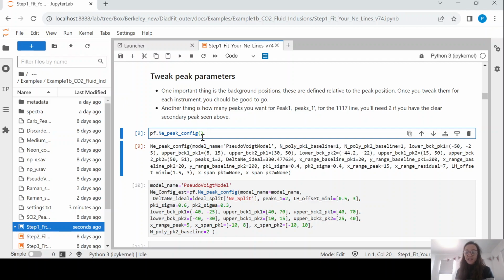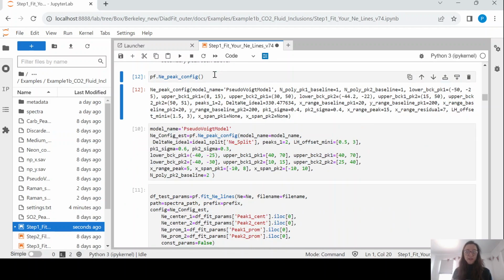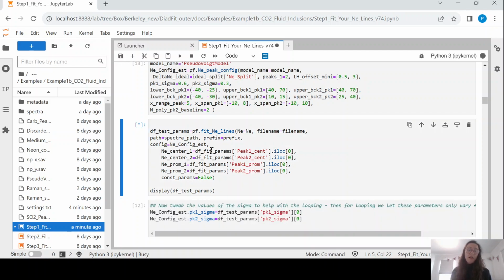And you can change any of these parameters at any time by just typing the parameter name, peak 1, and then you could say 5 instead of the default being none. And you could list any numbers of these. So you could change the model name to be a Voigt model rather than a pseudo Voigt model. So that is how you edit the default parameters. And you can see down here, we are basically printing it to have a look. And then we are tweaking this for our instrument. So really key parameters are the background positions and the sigma of the peak, so how broad the different peaks are. Okay. So then you can basically fit one neon line and see if those parameters look okay.